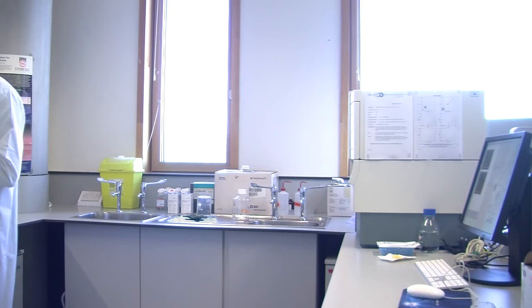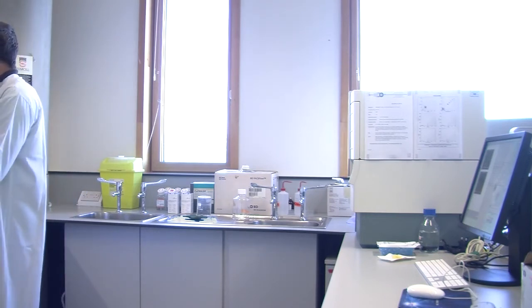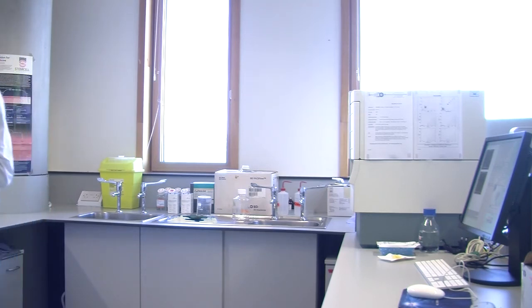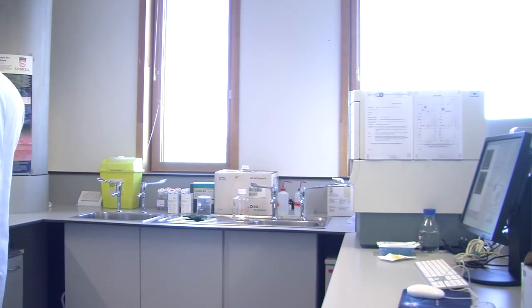Now the problem we've got is we don't know how generally sticky our cells are. They might be really sticky, they might be not sticky. More of a problem is we're looking at 3 different cell types. What if one of your cell types is really sticky and one is not sticky at all? The one that's really sticky would bind loads of antibody anyway and would be quite bright. And we're trying to work out what's got our markers on it. We don't care about the general stickiness, we want to look at our markers.